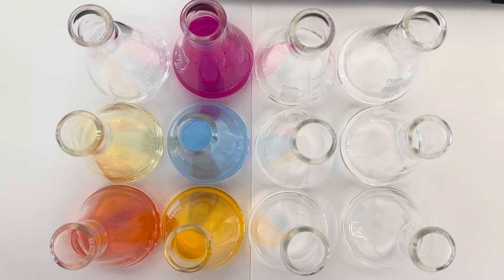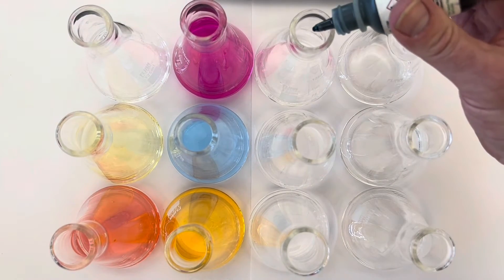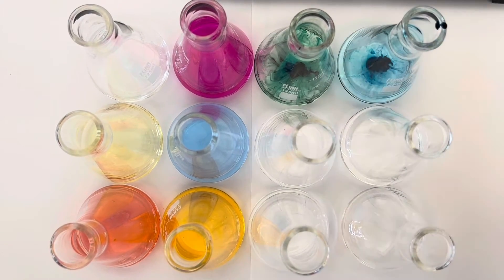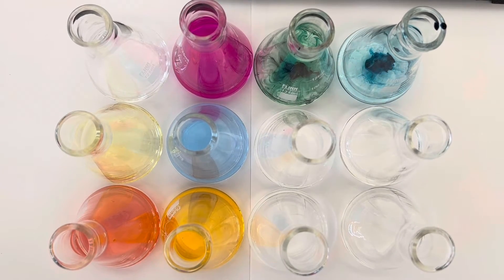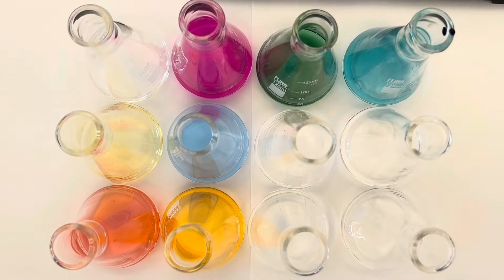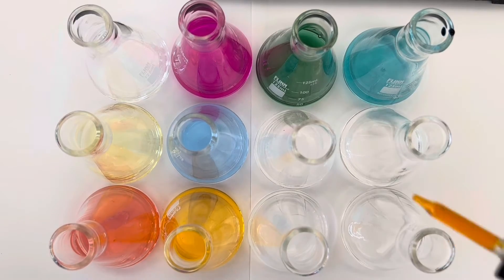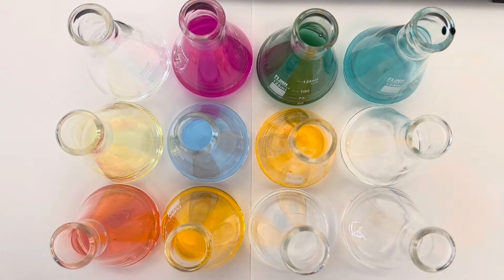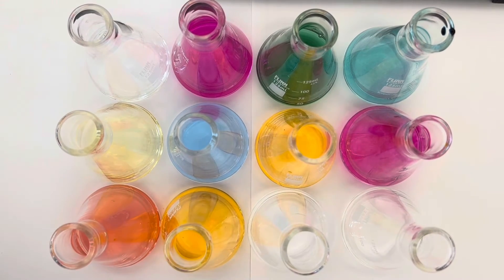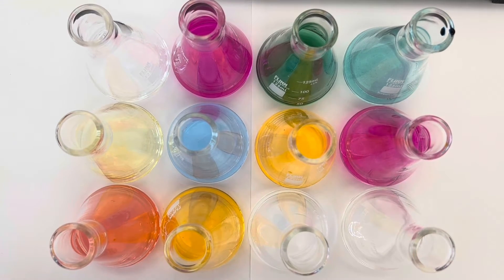I have here some malachite green. By the way, acid-base indicators have some of the best chemical names in the world. You can see that in acidic solution and this in basic solution. So let's give those a stir so we can see them in all their glory. Phenol red is that color in acidic solution, and that cool pink color in basic solution. I also brought out some universal indicator, which is actually a mixture of indicators.